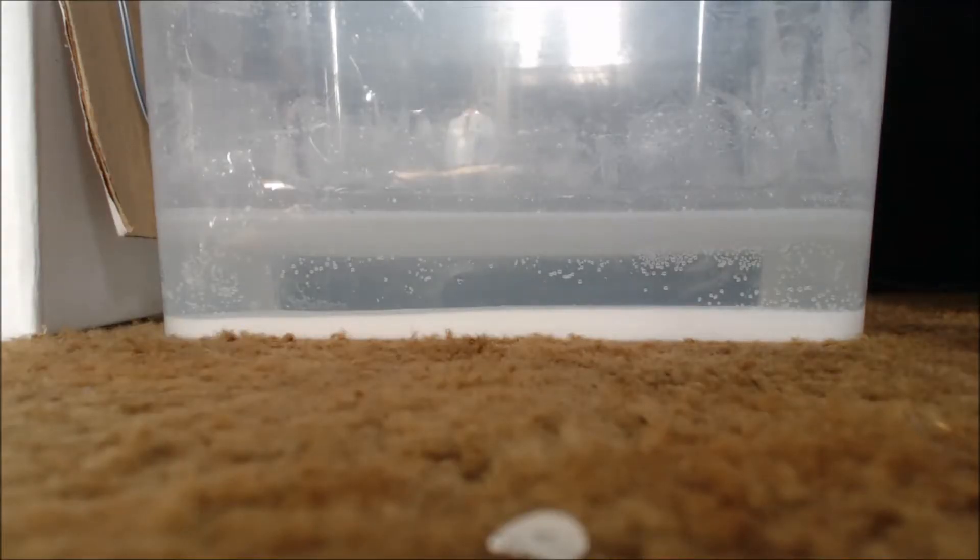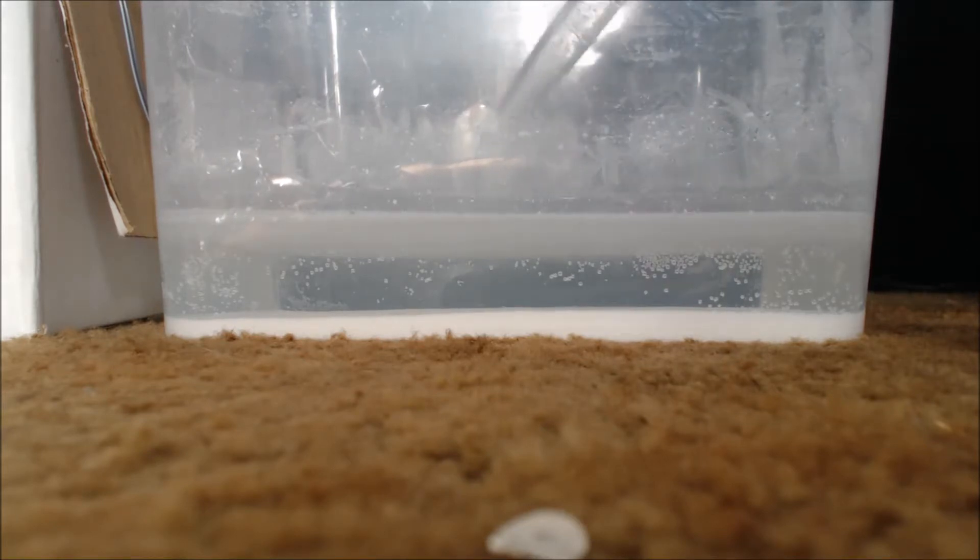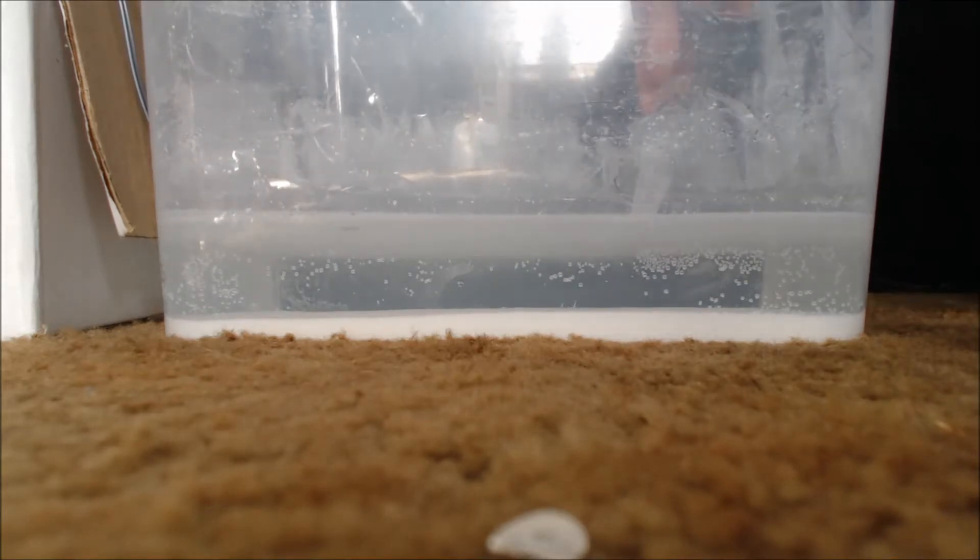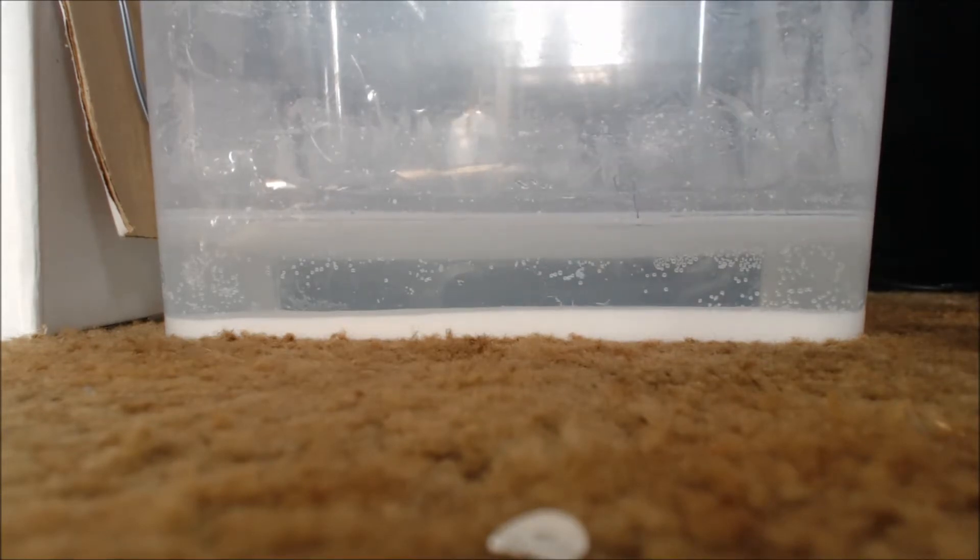Get out a little at a time, so you get it all the way down. So after a couple days it's actually compressed down more and I get some more water out of there. I just use my turkey baster. I'll just keep doing that until it gets down more. Once I can't do this anymore, I'll throw it on the heat, on the radiator, so it evaporates all the water off, or at least most of it.